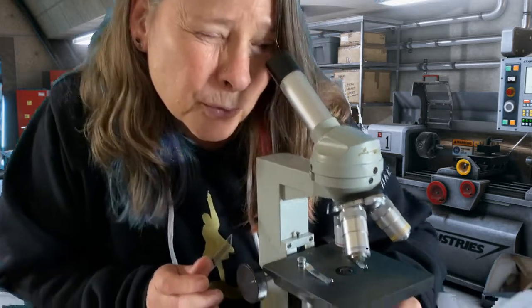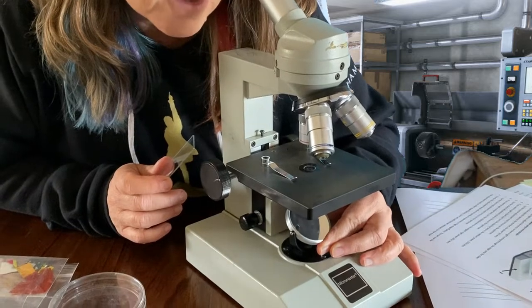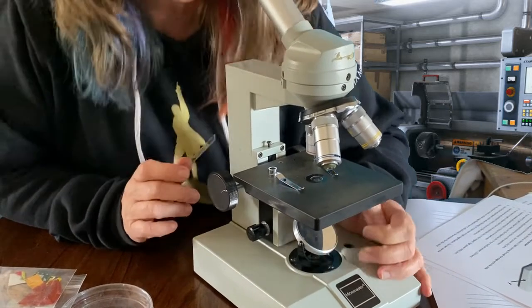Hi there, we're back. I'm going to show you how you would look at something in the microscope step by step. The first thing, number 1: if it has a cord, you need to turn it on. You need to make sure there's light coming in. So with this one, we're going to make sure that the mirror is adjusted. What I need to do is look through the eyepiece and adjust the mirror till there's light coming in. Okay, now I've got light in, so that's step 1.